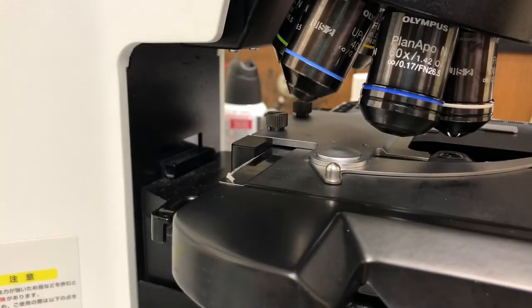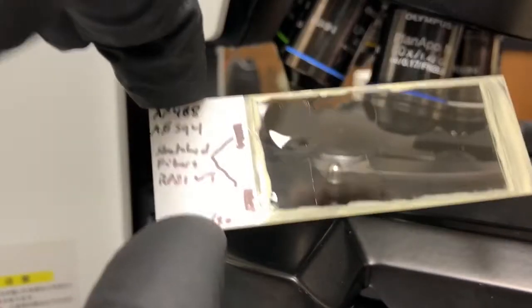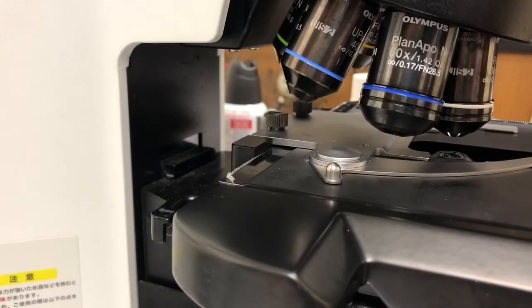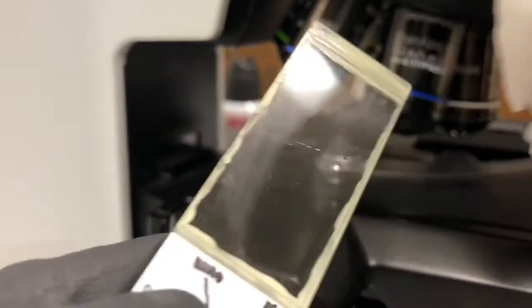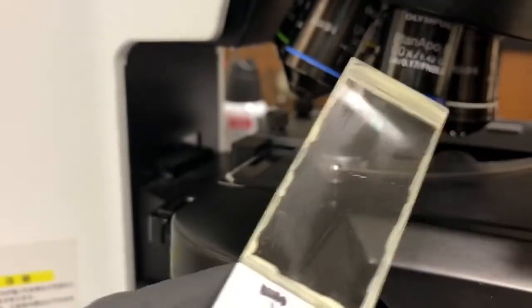So that's pretty much it. We can now clean the sample as well which we can clean just with a Kim wipe. We don't need lens paper to clean the cover slip on the sample. And it's highly recommended to clean them. Don't leave them with oil because then if you try to use them with another objective or on another microscope that oil might dry out and cause all sorts of problems. So take a moment to really make sure that you clean your samples nicely.